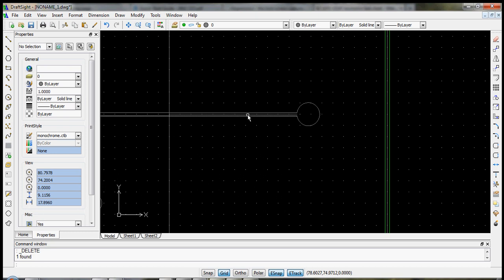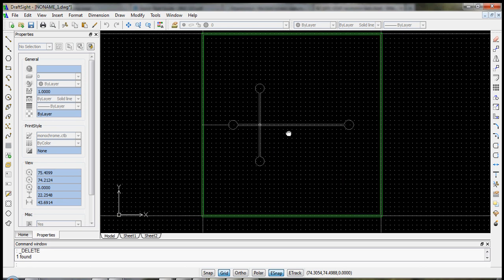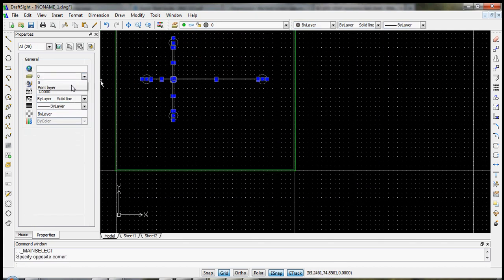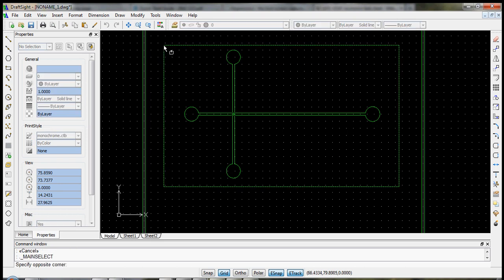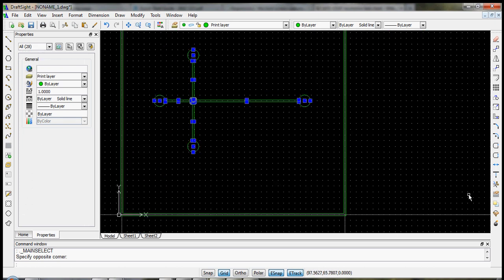Let's delete some of our construction lines. And let's bring these all now into our print layer. Okay, so I think we're looking pretty good now. The only problem is, let's select these lines and see what we have. With 28 elements, we have some arcs and some lines. Now remember, we want to have polylines. So what we can do is go to this command called Edit Polyline. Edit Polyline is near the bottom right of the icons.